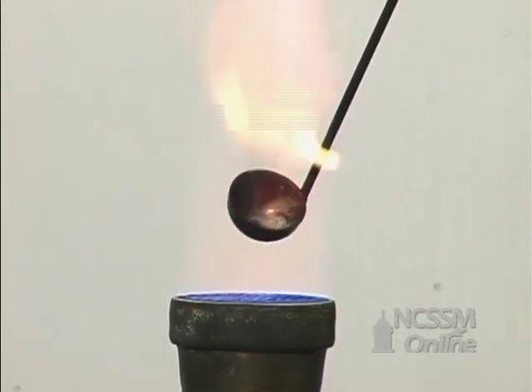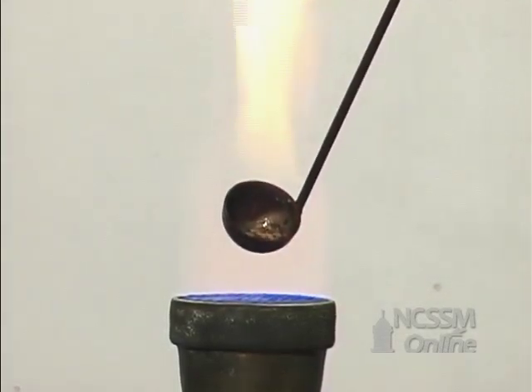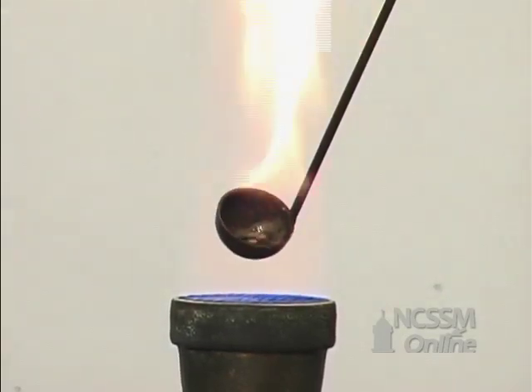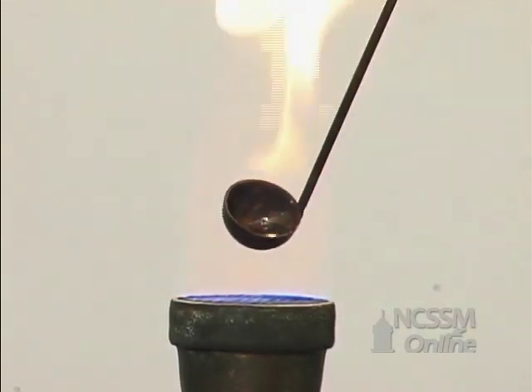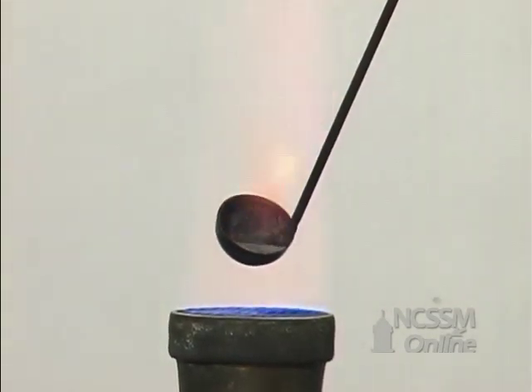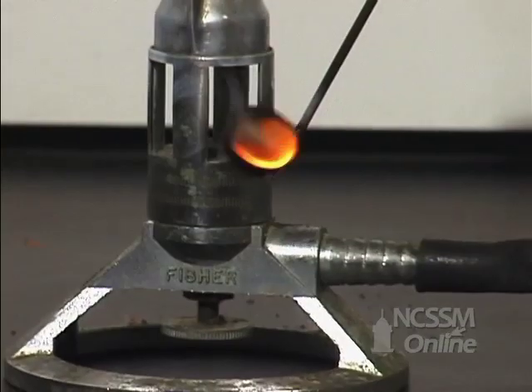If we heat potassium metal, we see that it melts very quickly. Potassium has a lower melting point than sodium. It starts to react very rapidly with the oxygen in the air.